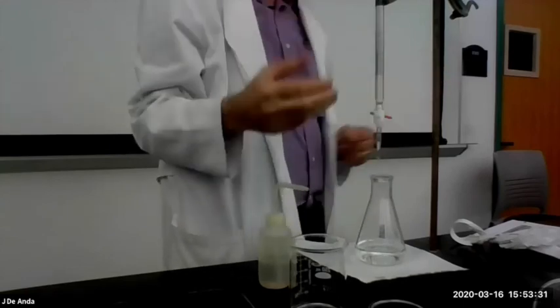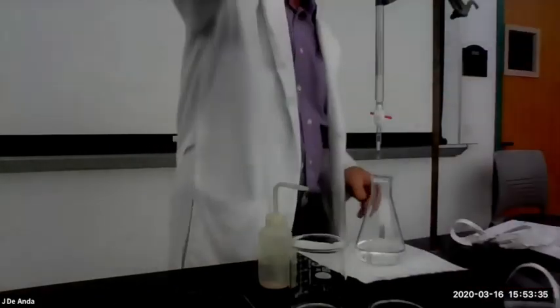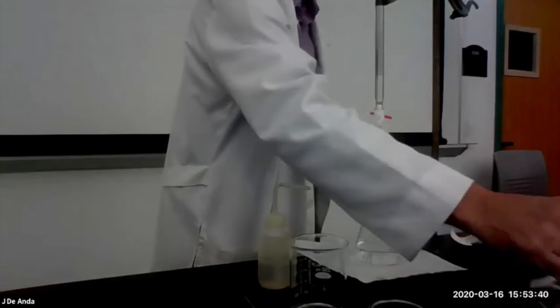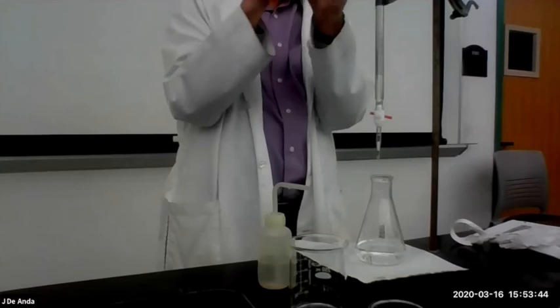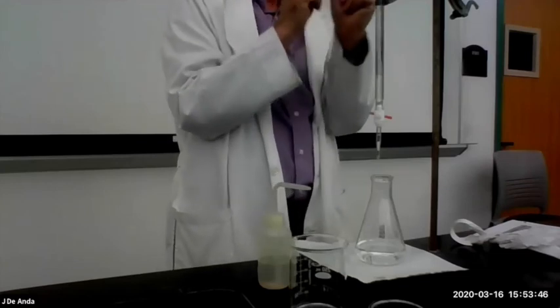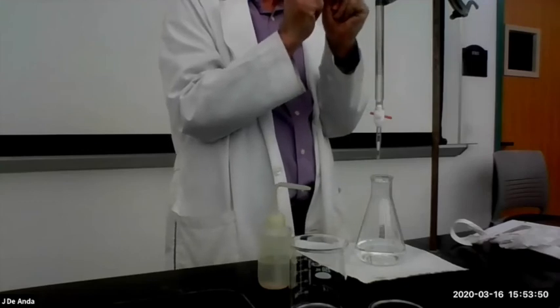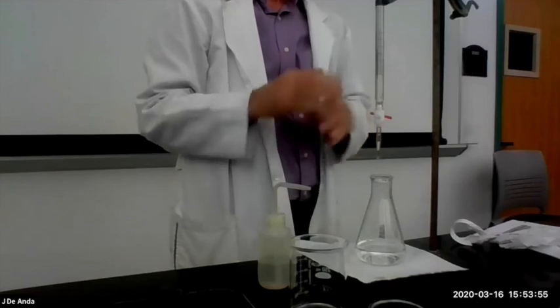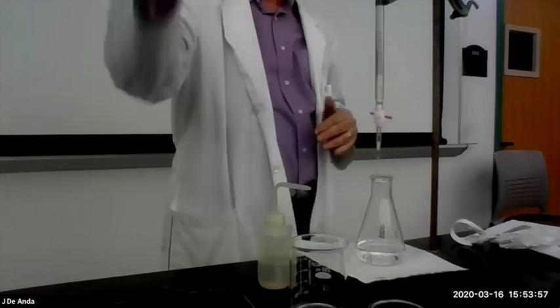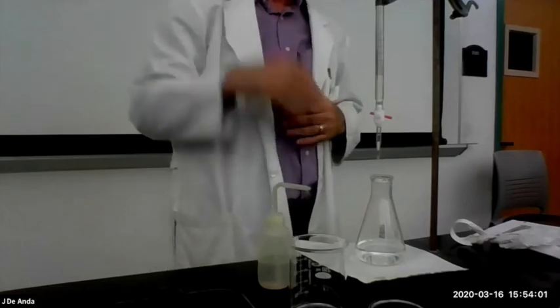And for your second trial, you prepare another reaction flask with the rest of your KHP, same as you did here, and repeat the titration, all right? Now, your goal is for 2 titrations to be within about 5% of each other in the final result. If you overshoot one, if it goes to neon pink, just call it off and do another one. But you can only do a maximum of 3. That's the most you can do, all right?